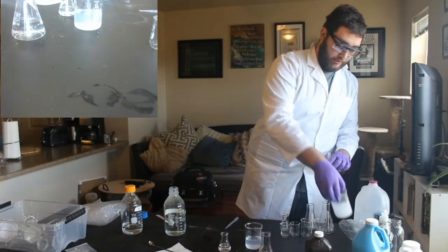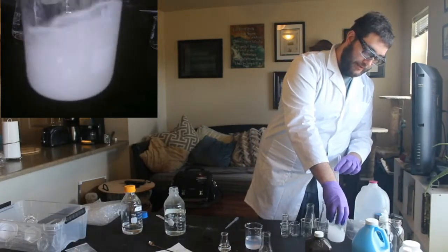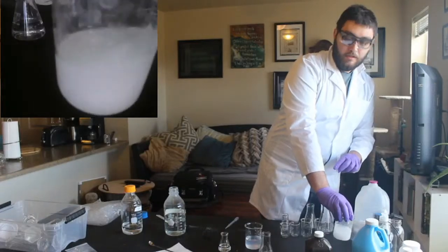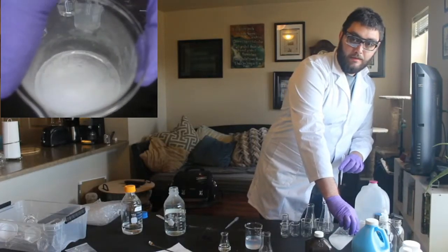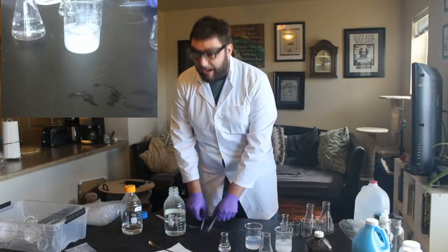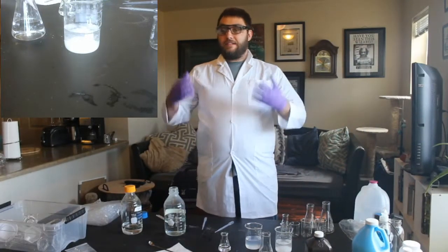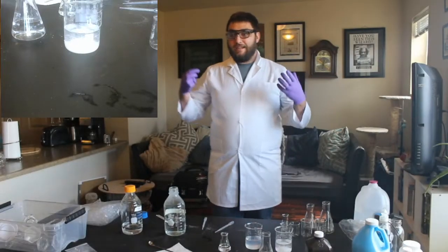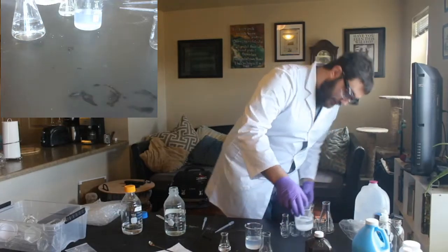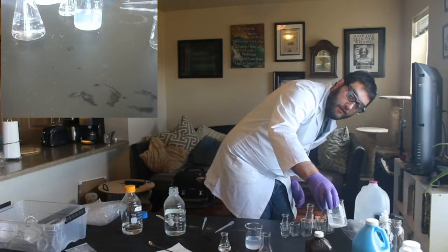And again, I'll do it really up close so you can see it swirling. I think that looks really cool. And then down in there, because it's what's called a precipitate or a solid, it is really heavy. And it falls out of the solution and it becomes this snow-looking stuff.